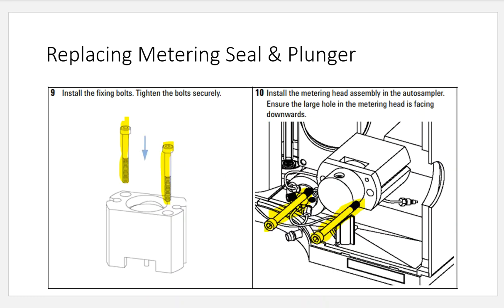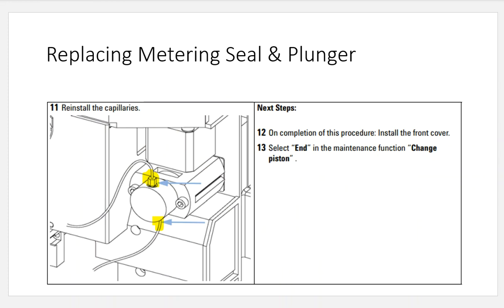And then you're going to take these lock screws and place them inside of the analytical pump head, and you're going to screw them back together. That locks the system back in place, so that you get a nice tight fit between the two halves of the analytical pump. Or not the analytical pump, the metering device. So with that said, once this container gets situated back together, you place the entire system back on the autosampler, and now your metering device is ready to take these two long screws, and you'll just insert them back into the sides, tighten them back up with the hex wrench, and you're good to go. Connect the two tubing lines back together, and now you get a hopefully analytical head that is going to be able to have the suction power that you need with very few leaks that you're going to see now, and your reproducibility is going to be much, much better than what it was before.